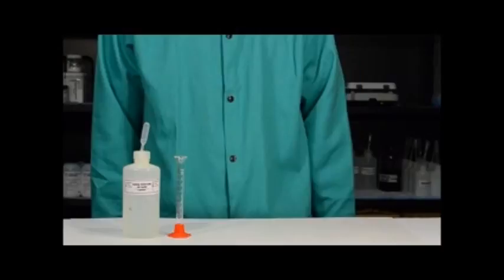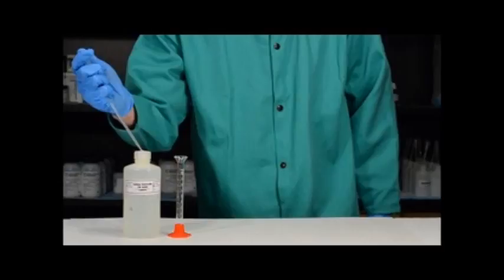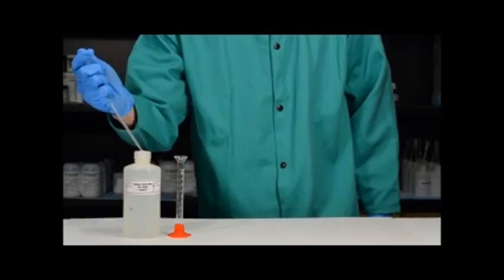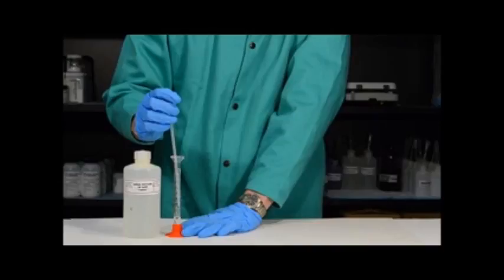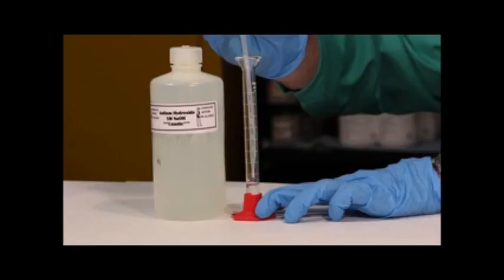For the titration you're going to need a 5 molar sodium hydroxide solution and a 10 milliliter graduated cylinder. The first thing you're going to want to do is transfer 2 milliliters of the sodium hydroxide solution into the graduated cylinder using a pipette. Once you've added approximately 2 milliliters, hold the graduated cylinder with your hands, move your eye down to the level of the graduated cylinder, and remove sodium hydroxide so that you have exactly 2 milliliters.